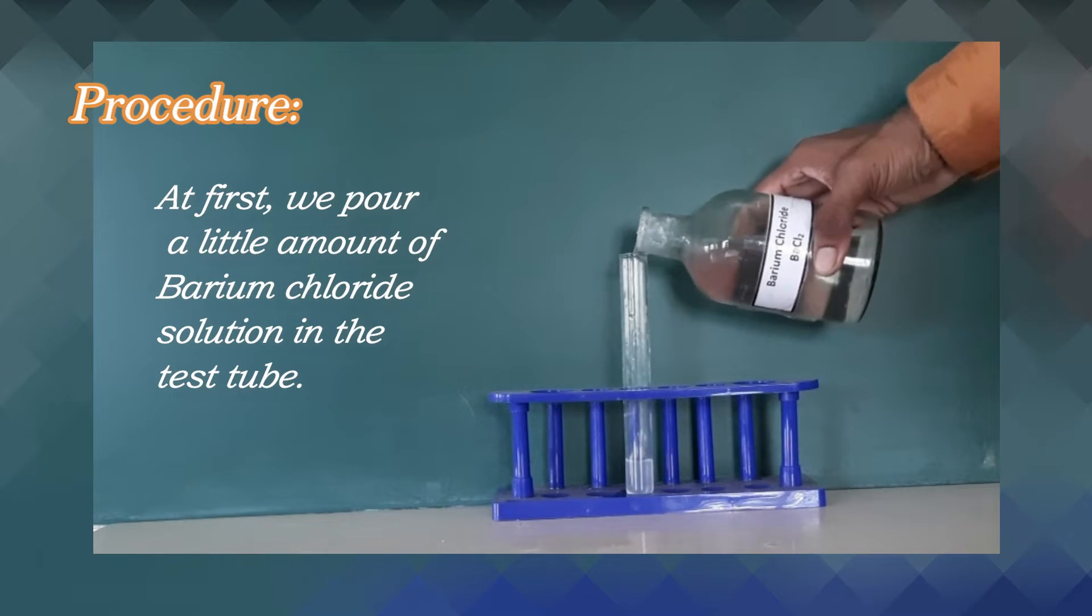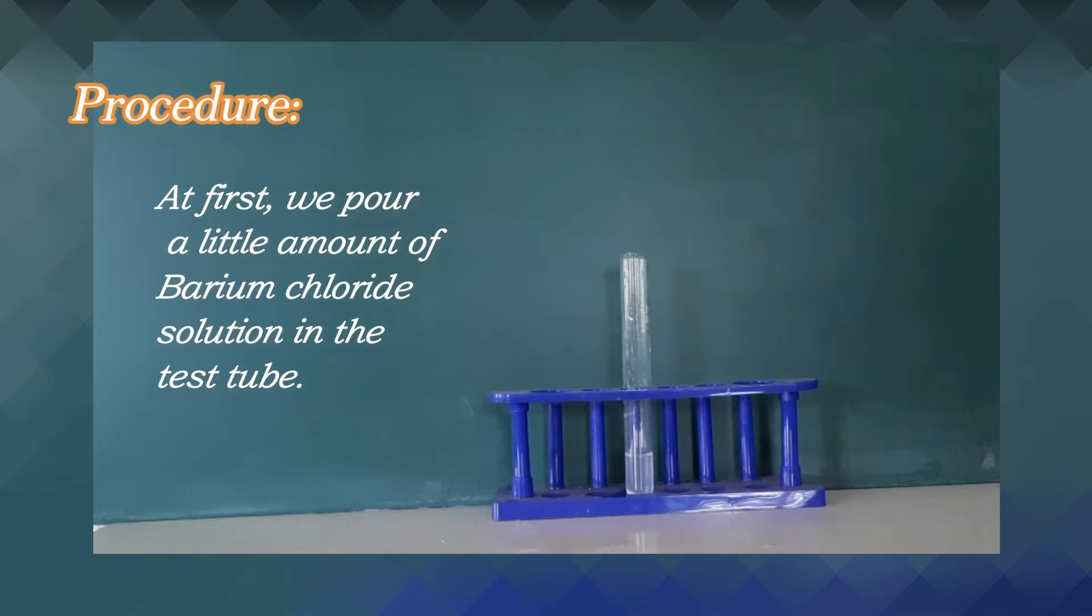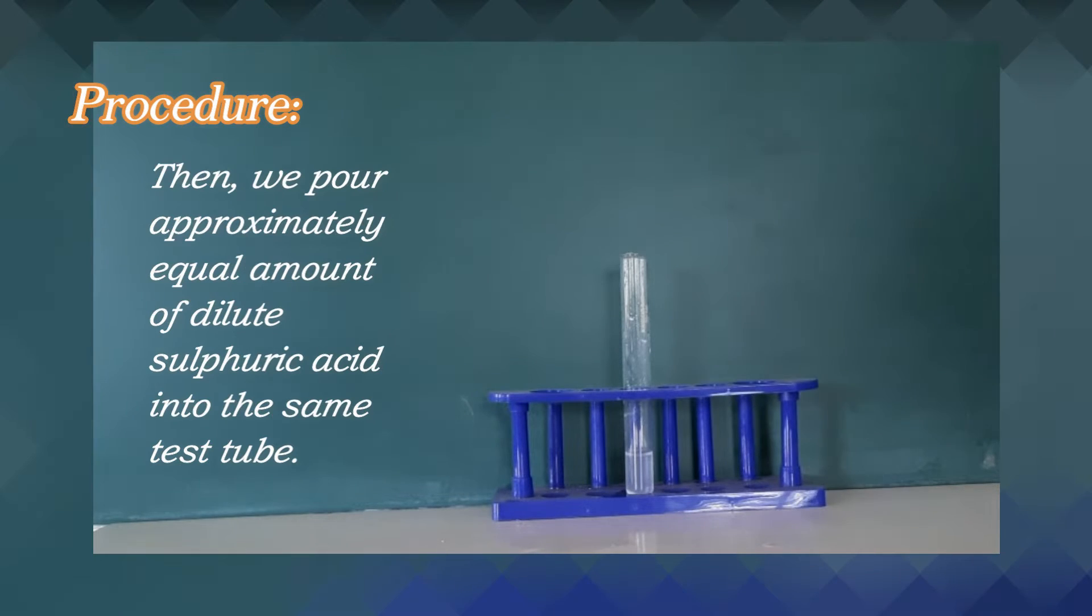we pour a little amount of barium chloride solution in the test tube.